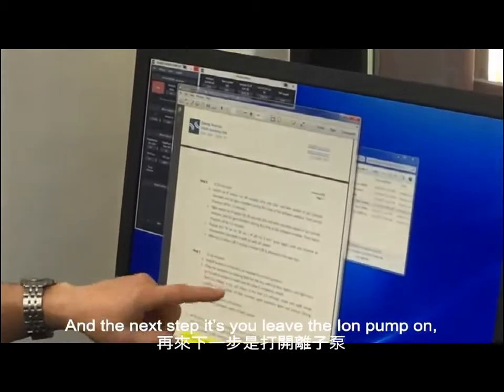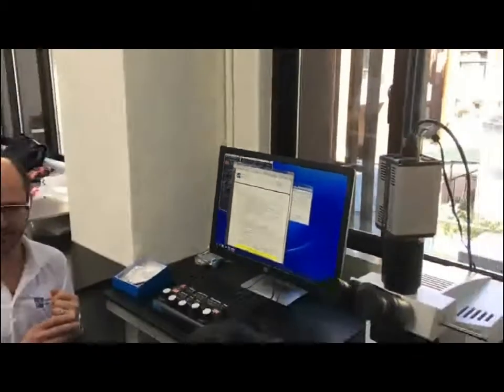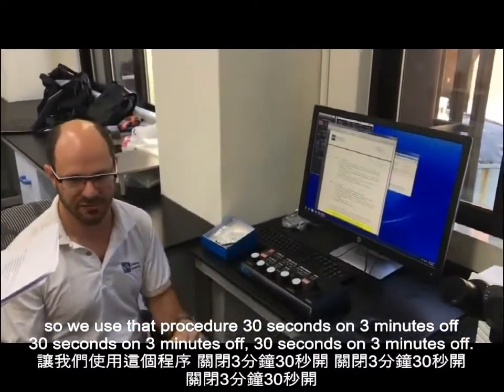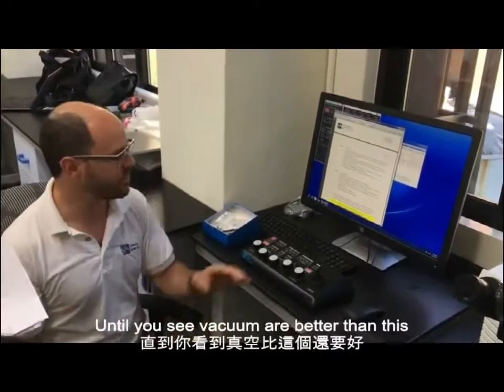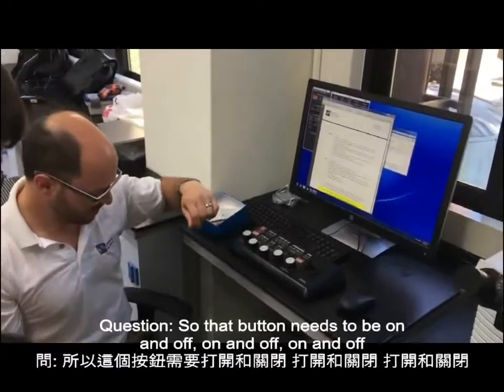And the next step is to leave the ion pumps on. So you've reached the minimum vacuum level to use the ion pumps. So we use that procedure, 30 seconds on, 3 minutes off, until you see vacuums that are better than this. So that one is on and off, on and off.